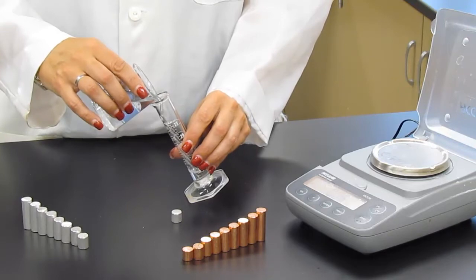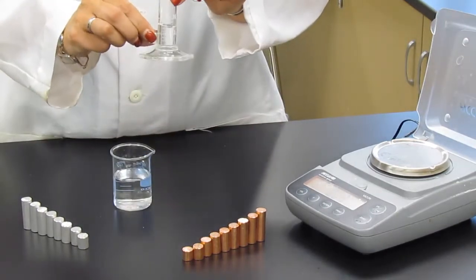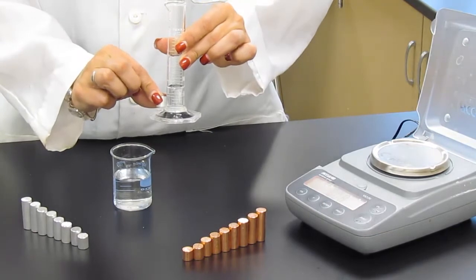Add a little bit of water, basically enough water so that you would be able to completely submerge your cylinder in there.